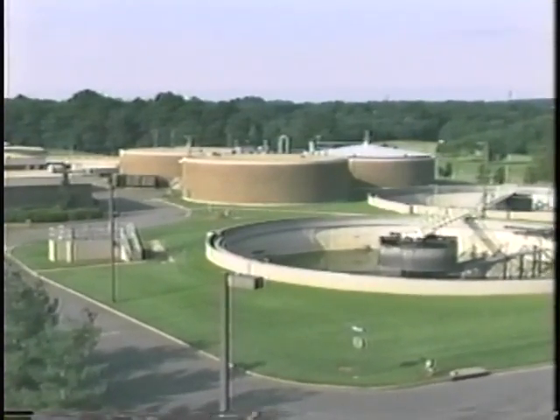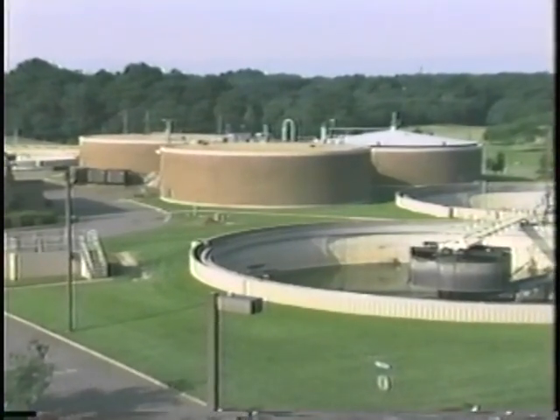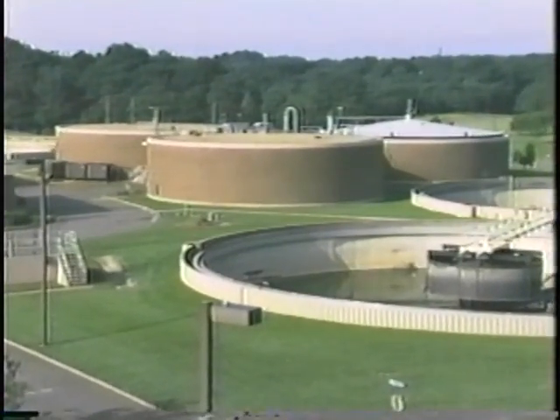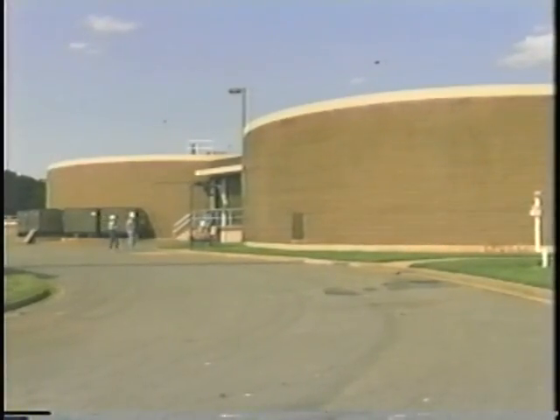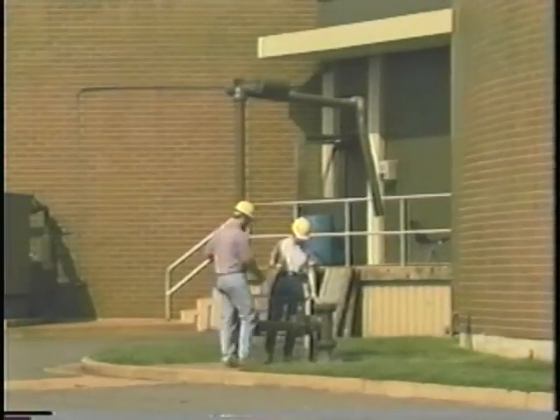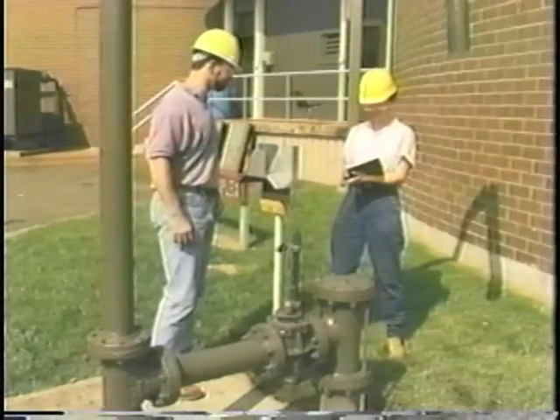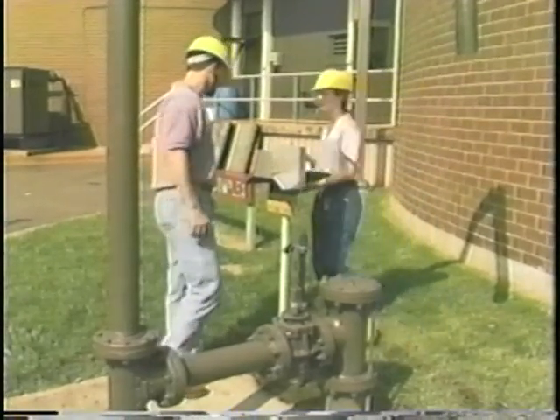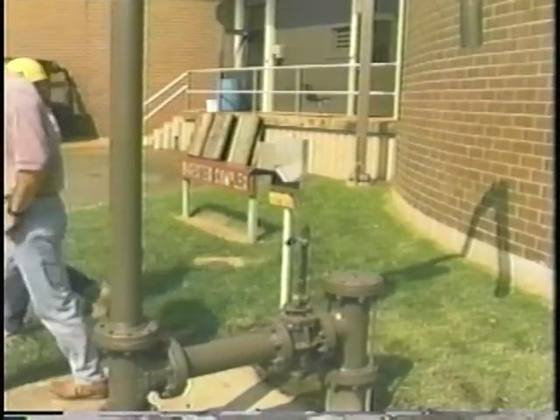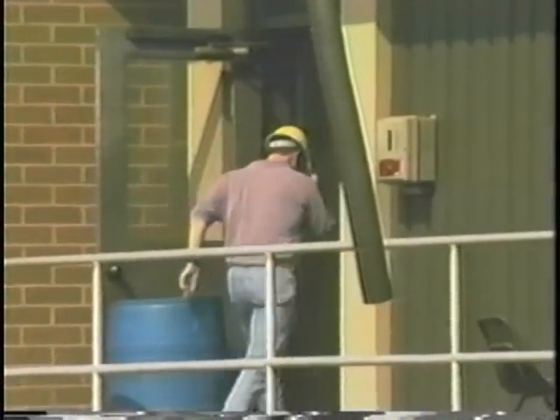This plant has an anaerobic digester, which discharges liquid sludge to tanker trucks that haul the sludge to land application sites. The key is to find a safe location to collect a sample before it is loaded into the truck. The truck loading port would be good, except that the pressure under which the sludge is pumped into the trucks is too great to allow us to safely collect samples. Most facilities have a sample tap inside that they use.